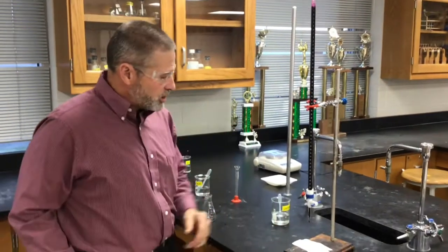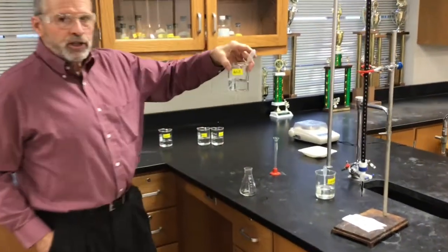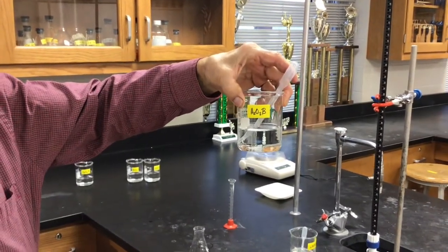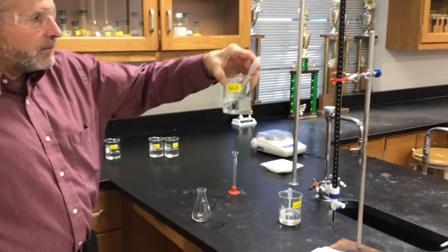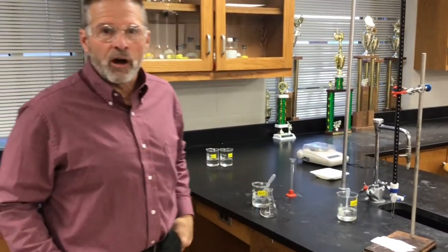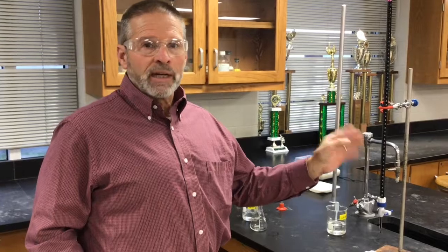We know the concentration of the permanganate. Here is our unknown hydrogen peroxide solution. We're calling it sample B. Now, last time we had to add phenolphthalein, you recall, as an indicator, so we can mark the stoichiometric point. Permanganate's nice because it's its own indicator.